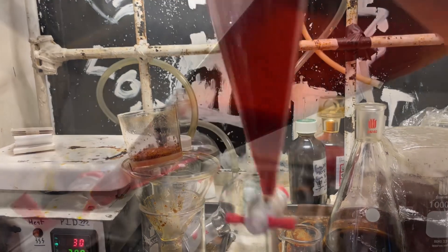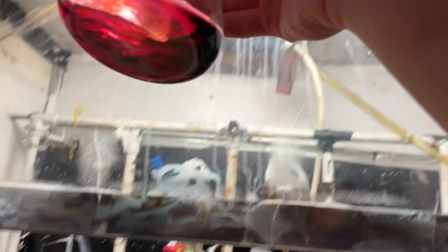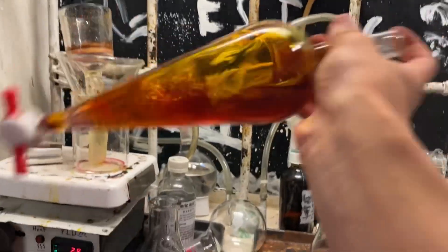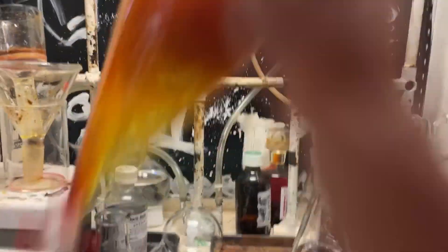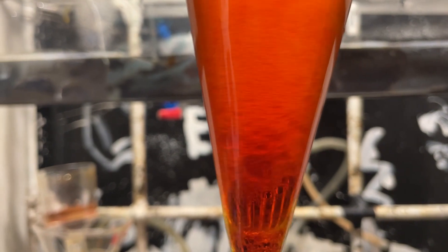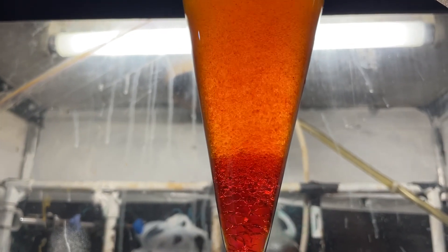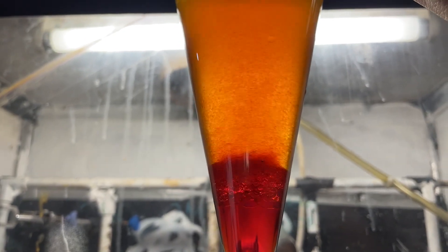The original plan was to separate the dichloromethane from the iodine by distillation, but I found that didn't really work well. You can see the iodine/dichloromethane solution — very pretty. Nice wine color, and in dilute concentrations a nice pink color. I still have to ampule various solutions of iodine in different solvents. I just couldn't stop having fun with it — it's so pretty. The camera doesn't capture it well, but iodine is just pretty. I'm very entertained by colors.